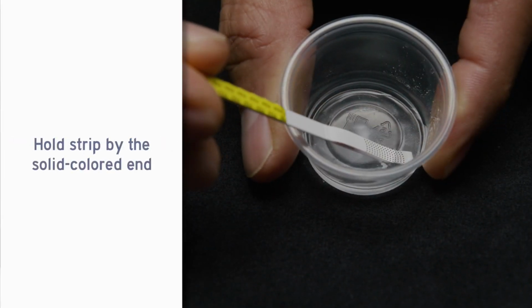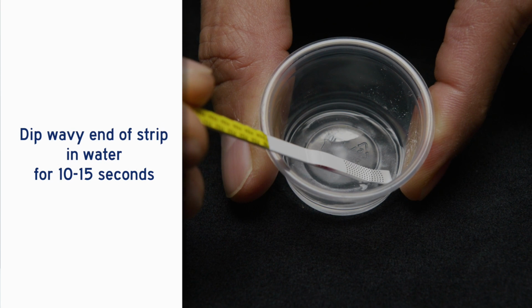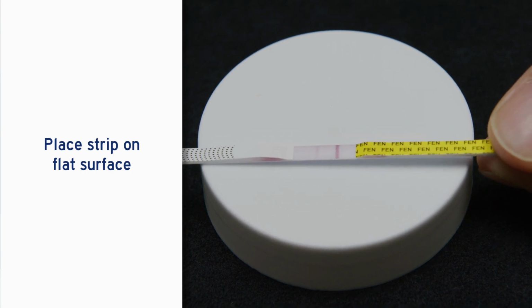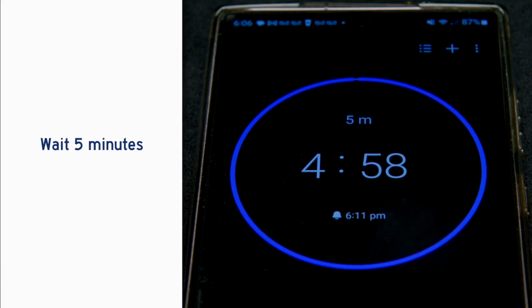Hold the strip by the solid colored end. Dip the wavy end of the strip in the water for 10 to 15 seconds. Place the strip on a flat, hard surface and wait for 5 minutes before reading the results.